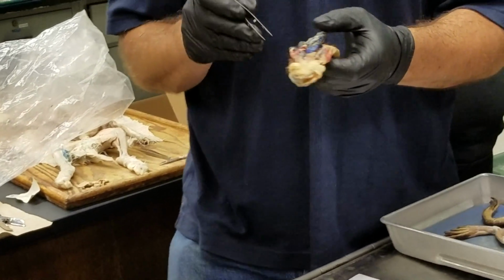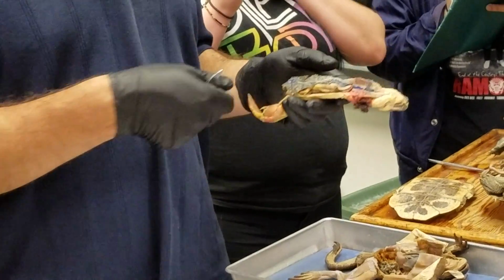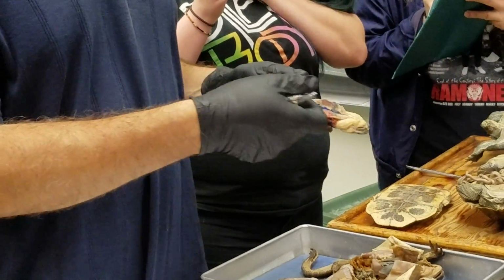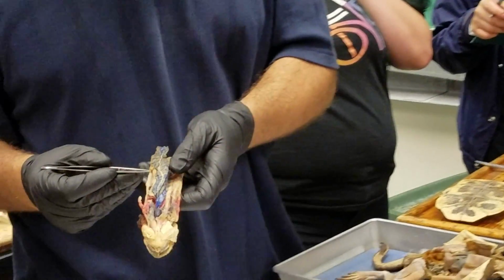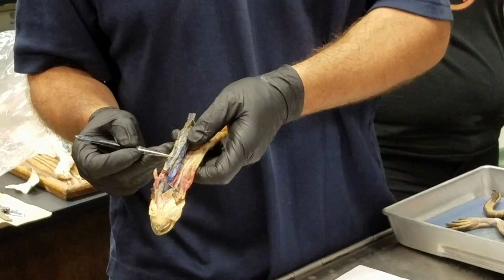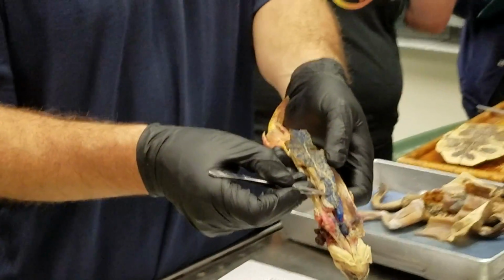Okay. There's also a left hepatic vein, and the caudal vena cava is really running into or through the right hepatic vein on the right side of the liver. But on the left side of the liver, there's another vein running along right there, and that is the left hepatic vein.